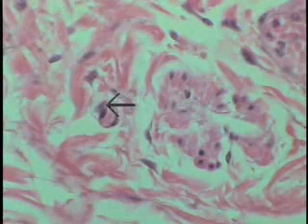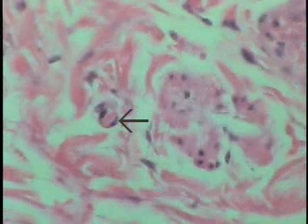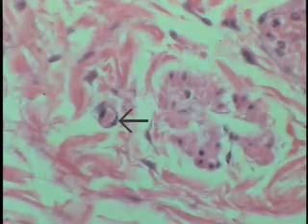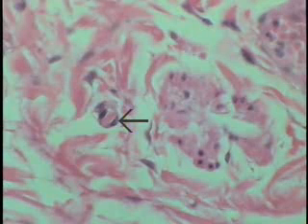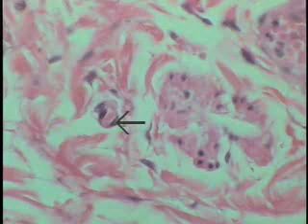The capillary wall consists of 2 endothelial cells, the nuclei on either side of this particular vessel, and these are lying on a very thin basement membrane that can't be resolved with this particular microscope and staining method. You can see that it has perhaps 1 or maybe 2 erythrocytes within the lumen. So this is the caliber of vessels where most of the exchange is going to take place, mainly being flushed out into the surrounding tissue by the hydrostatic pressure of blood within the lumen.